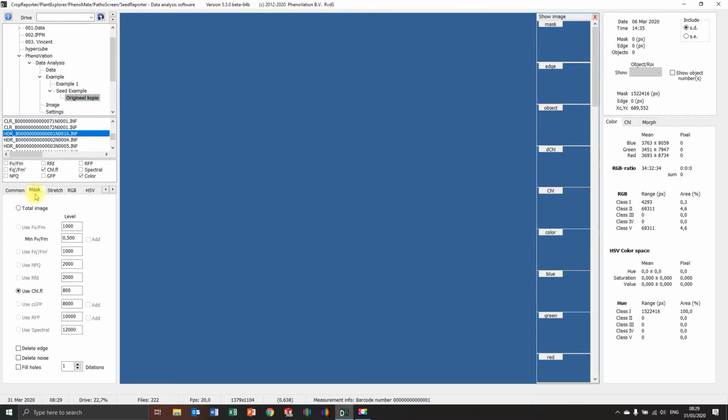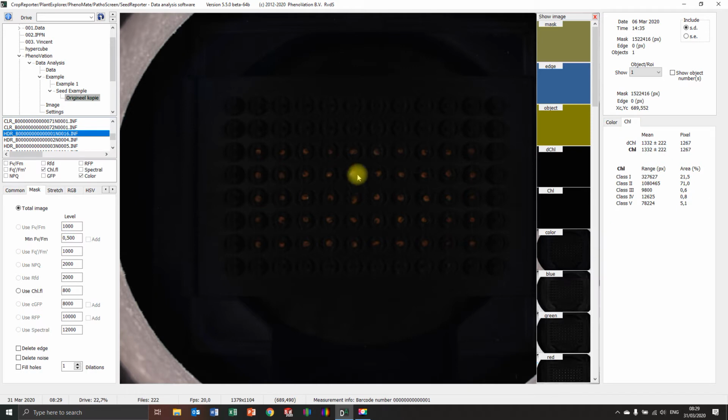And now I'm going to take a look at why it didn't mask properly. It's a really low mask. It's only 800. So I'm going to take a look just at the chlorophyll level. What's the chlorophyll level of a seed here? It's 1790. And you can see it over here, the pixels. It's 1700. You can also see the background is already 1300. So there's a really small difference between the seeds and the background. These seeds have a low fluorescence that makes it extra hard to get them out of the background. But we're going to try it anyway.